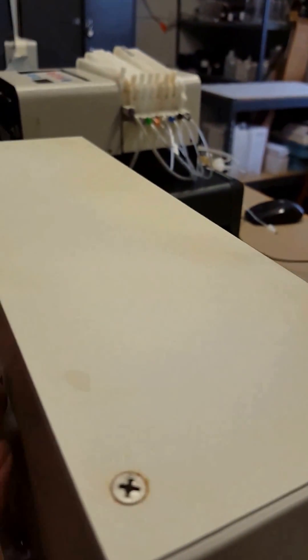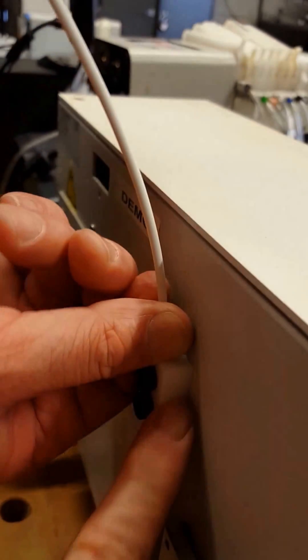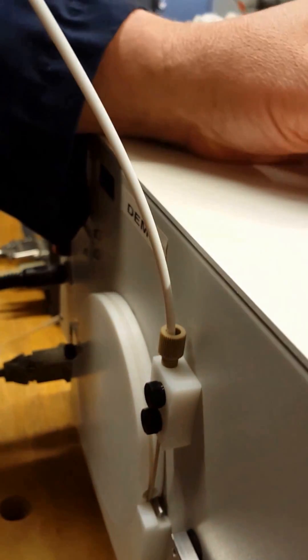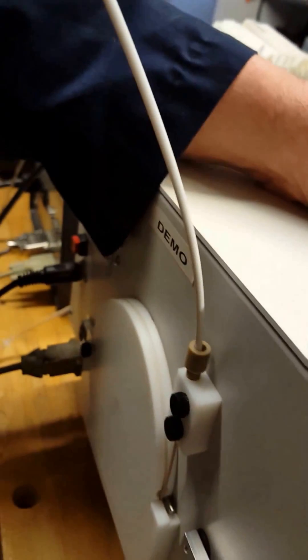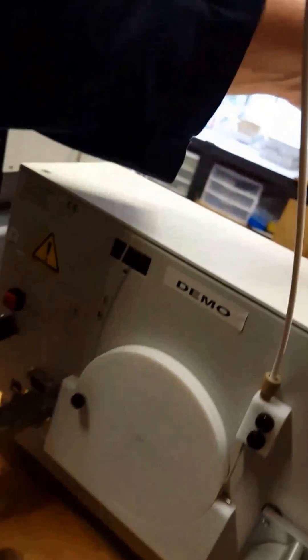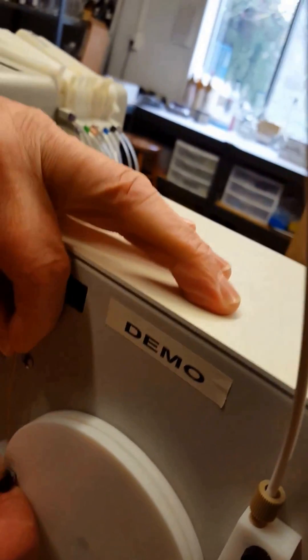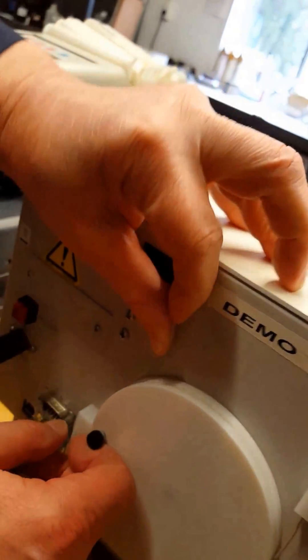There are two kinds of these little white blocks, but that's fine in either case. Then you're going to come over to the back side where you can see the PEEK tubing excess.